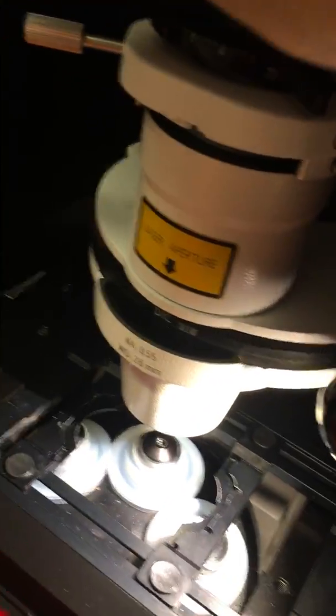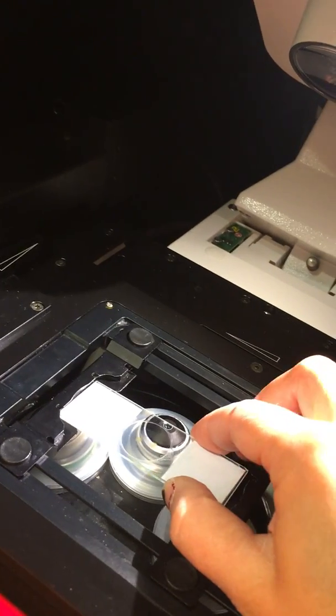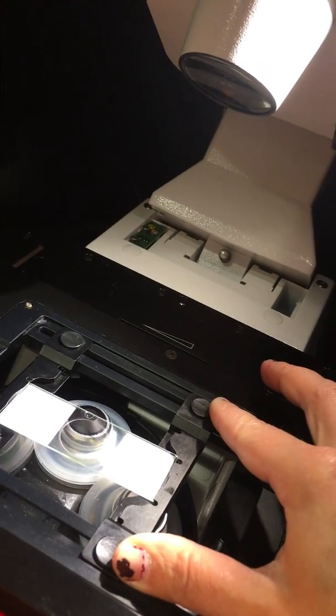To mount your sample, you can tilt the head of the microscope backwards very gently, without breaking it, please. And then place your sample between these two sliding holders, and you can adjust the holders' position as you wish.